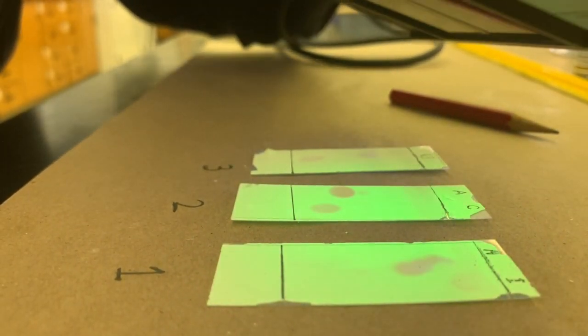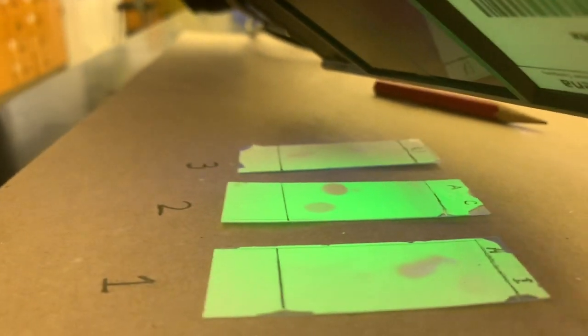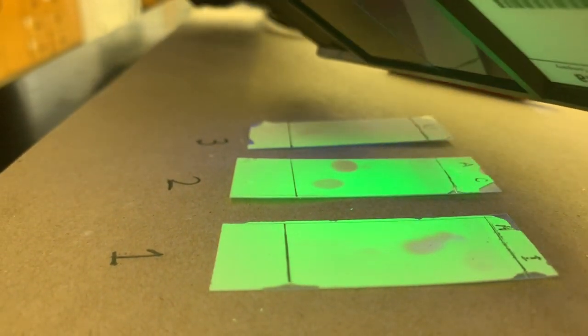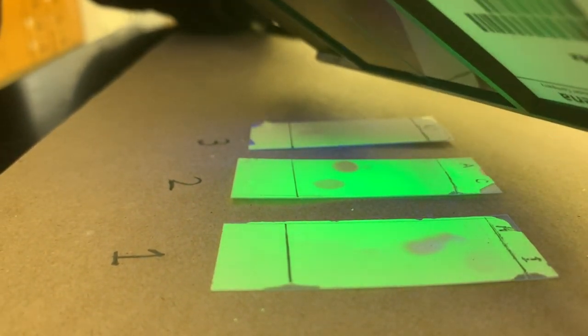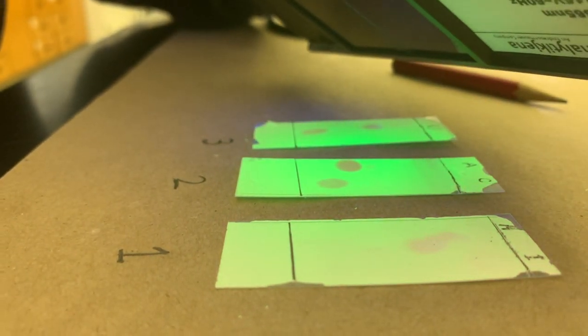All right. So here we are with our original mixtures of the products or samples. And the first plate, as you can see, had some issues. Plate number 2 came out a lot better.